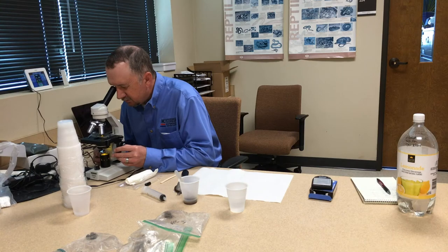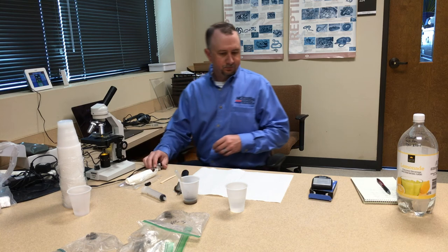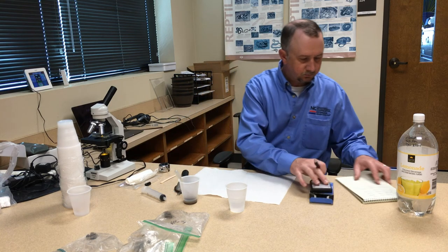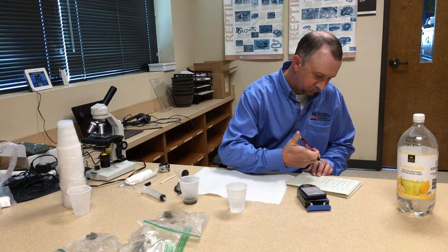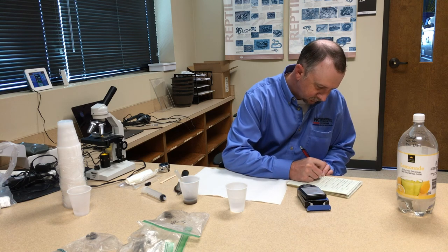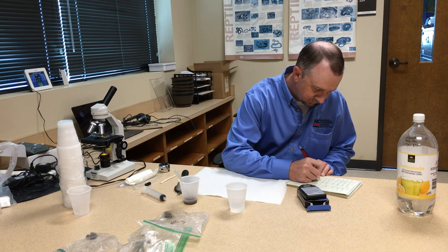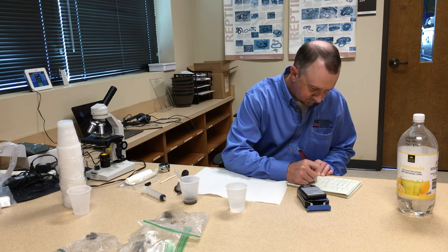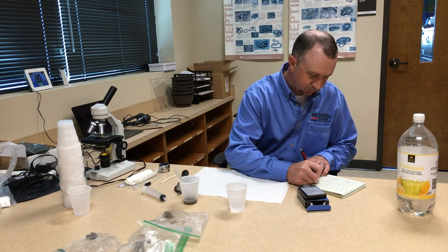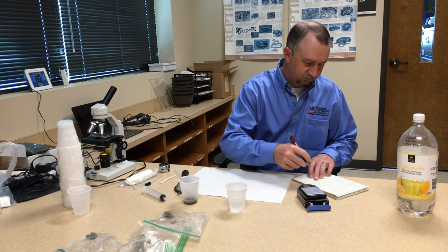Once you've counted all the worm eggs, it's important to write this information down somewhere that you can keep track of it. You may want to share this information with your veterinarian, and remember that any treatment options for parasites should only be implemented on the advice of a veterinarian. Also, many veterinary offices can perform fecal egg counts for you, as well as the North Carolina veterinary diagnostic lab system and other private laboratories.